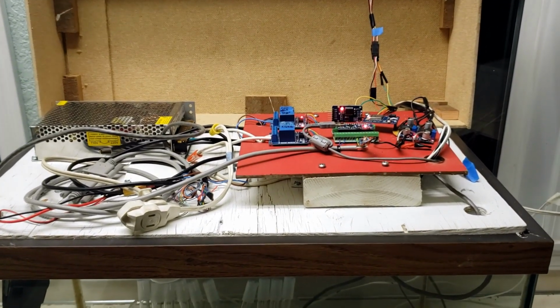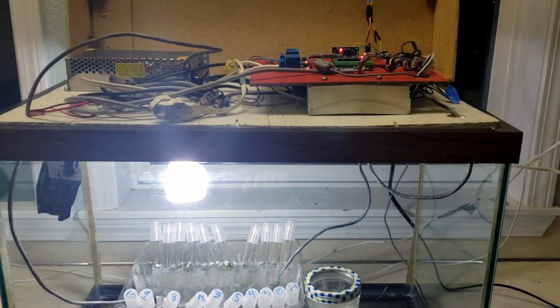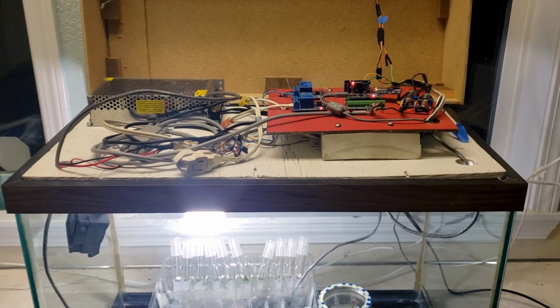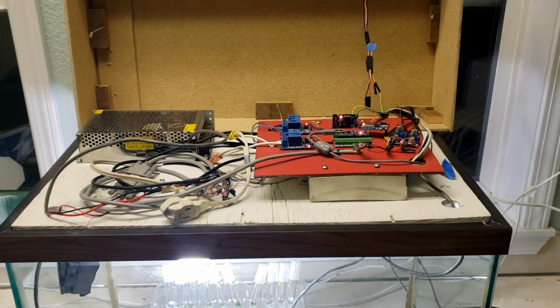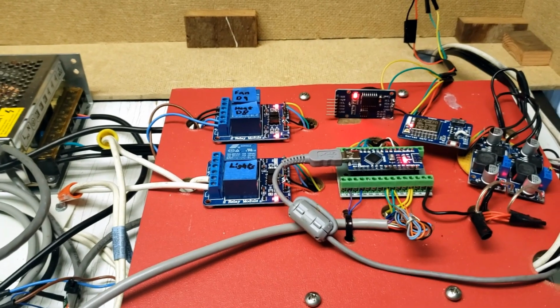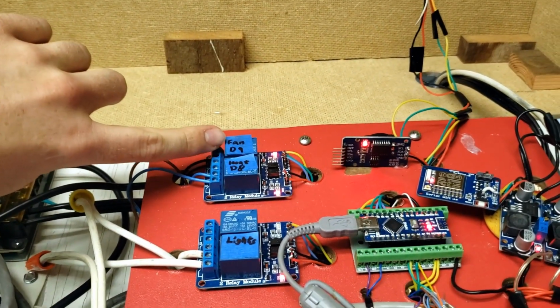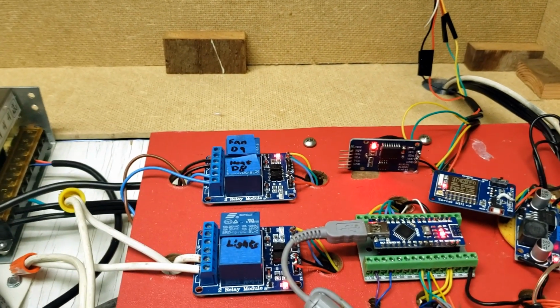Okay, I have the Arduino running a demo program now. Oh, there we go. The lights just turned on. And you might have seen that relay click on and off. Watch for the red lights at the top of the screen. I manually set the temperature to a lower number, so the controller board thinks that it needs to be heating right now. So what it's going to do is keep the fan on all the time. Then it's going to turn the heater on and off in 10-second intervals.